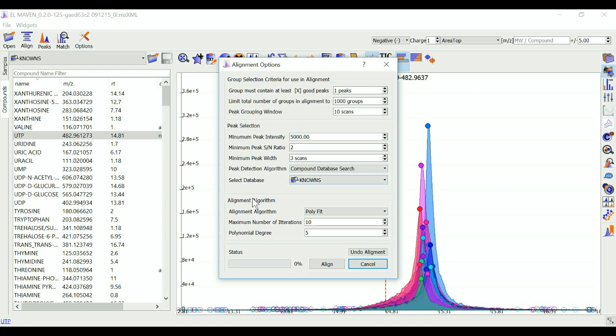The alignment algorithm panel provides the following options. There are two alignment algorithms available in El-MAVEN. One is polyfit and the other is LOESS fit. Maximum number of iterations is only required for the polyfit algorithm. Enter the number of times El-MAVEN should fit a model to the data in order to align it.